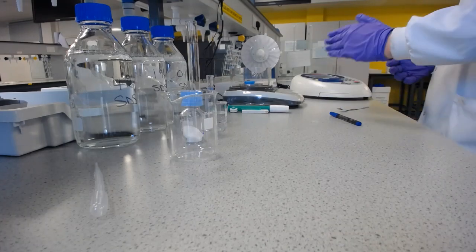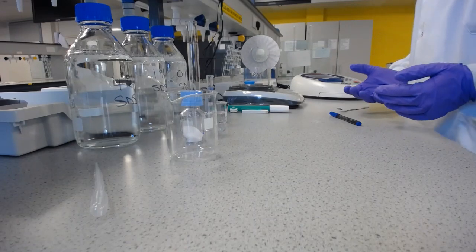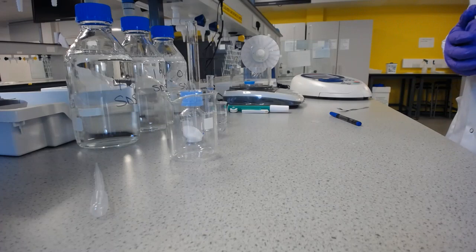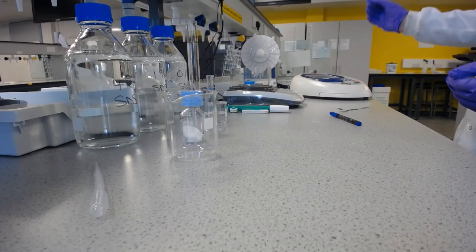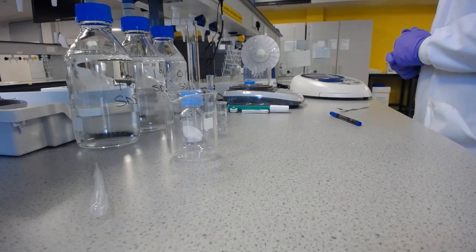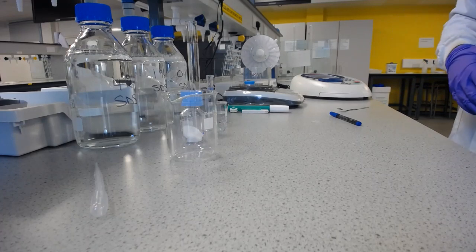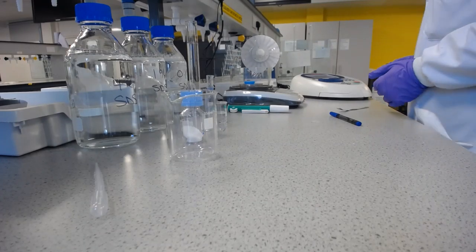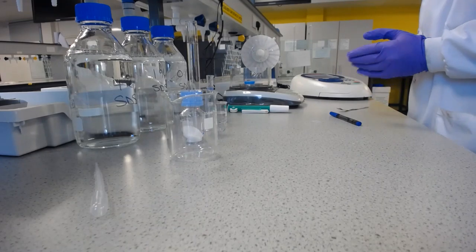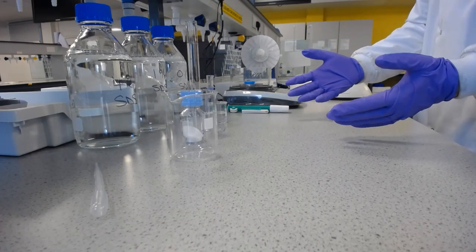If we then put a line of best fit through those, which in this case will be linear, we can use the equation of that line to then tell us what is the concentration of our unknown solutions, and therefore what is the maximum solubility in each of those, because we know that they're saturated solutions. I do a more detailed explanation of this in the labs from first semester if you want to go back to those. So what you did in the first semester is you made up multiple separate concentrations of your known ingredients.